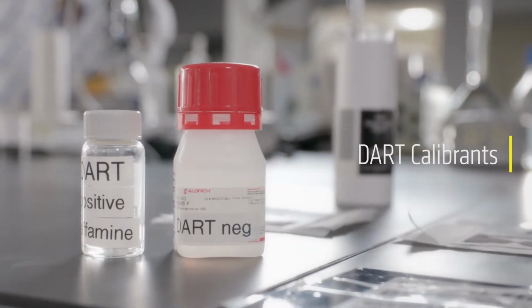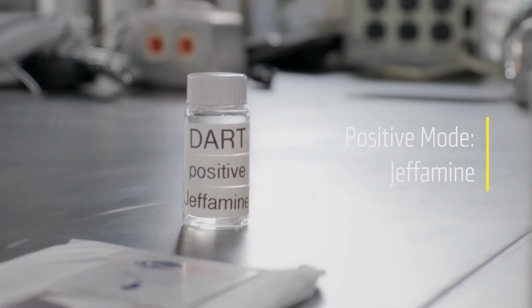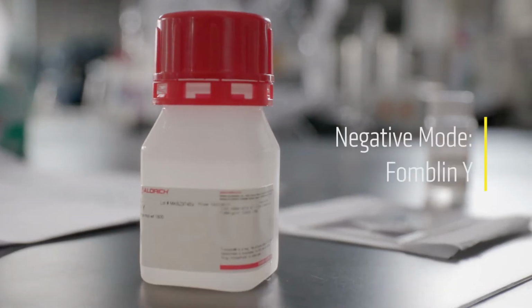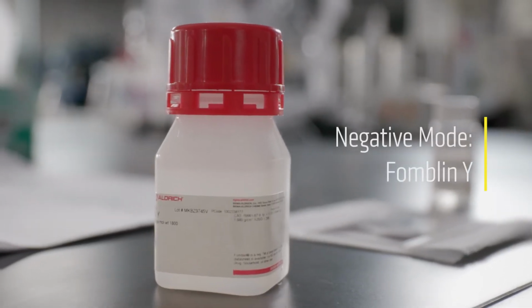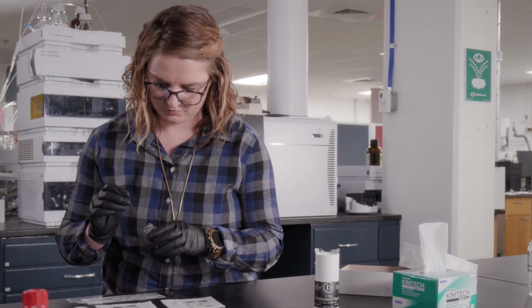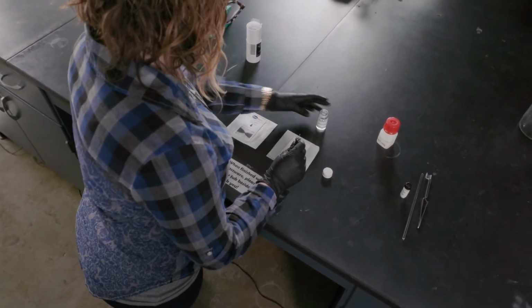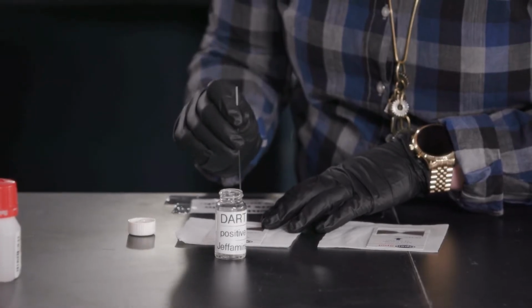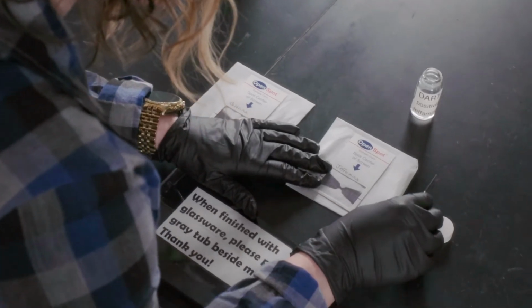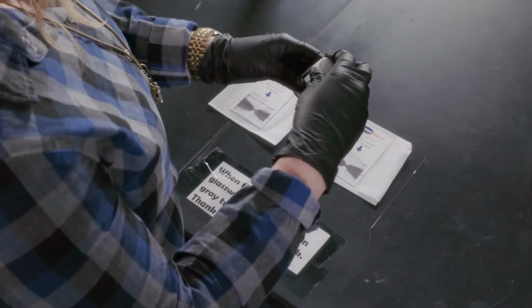You will also need a card spotted with calibrant for your sample. For positive mode, use Jeffamine, and for negative mode, use Fomblin Y. These calibrants are provided by the MMA and will be located with the rest of the DART supplies. If you have multiple samples, you can run the same calibrant card multiple times as long as the spectrum for the calibrant still looks good. When your sample and calibrant cards are dry, you are ready to run your samples.